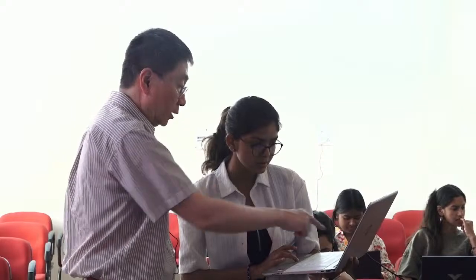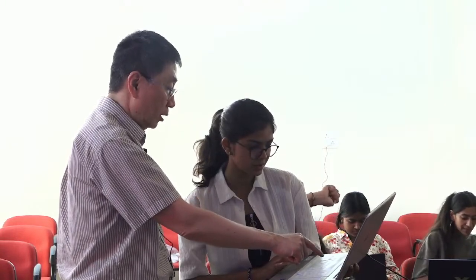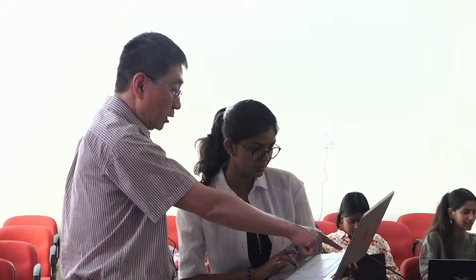Now what do we have to do? Add the terminal residue to the valine. Click on valine anywhere, anywhere on the atom. Yeah, there you go. So now it's the alanine, and now you can do Mutate, Simple Mutate, right here. Click on the atom, any atom. No, you click twice. Single. Try again. Simple mutation. Simple Mutate only. Select this. Click somewhere else.